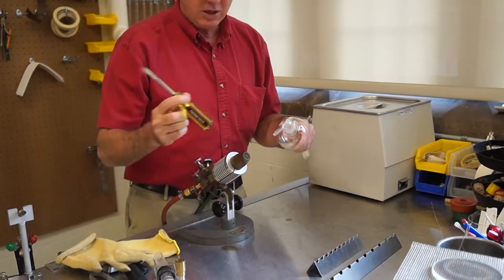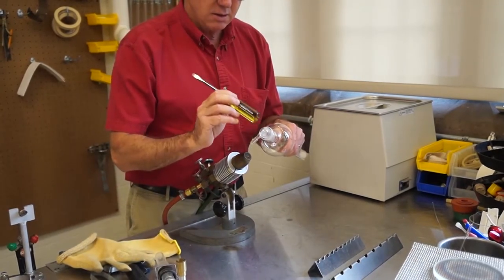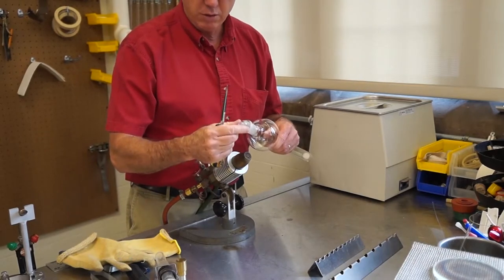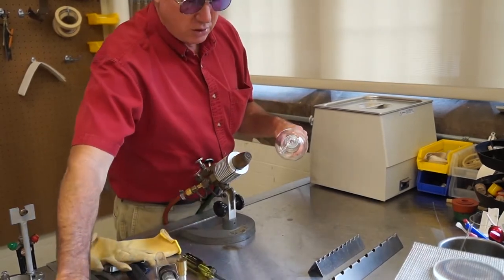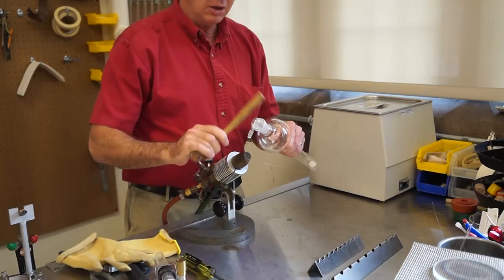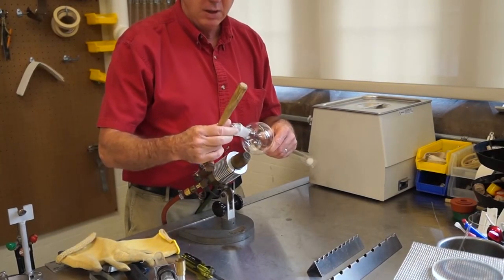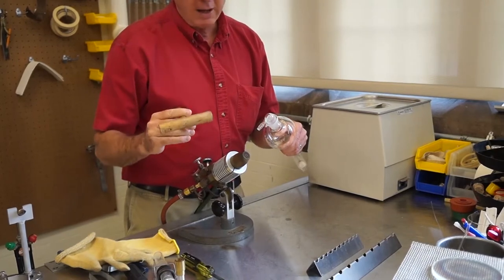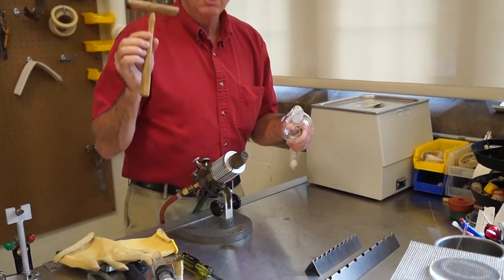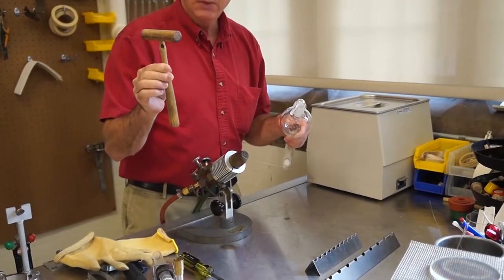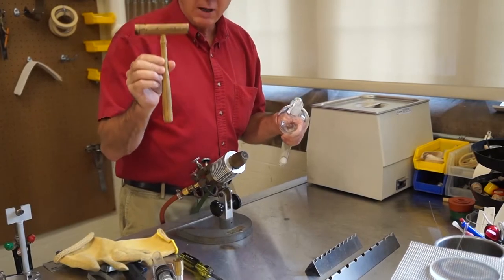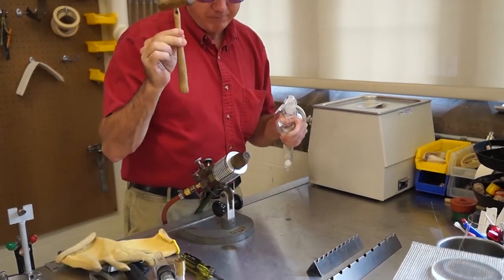Here I have a plastic handle and that's pretty good. You can also use wood, which is a very good substance. You can take it gently and vibrate that. It's excellent to have a wooden mallet. The best way to get a wooden mallet is to order a bushel of crabs and they usually throw a mallet in there with it. That's the best way to get one.